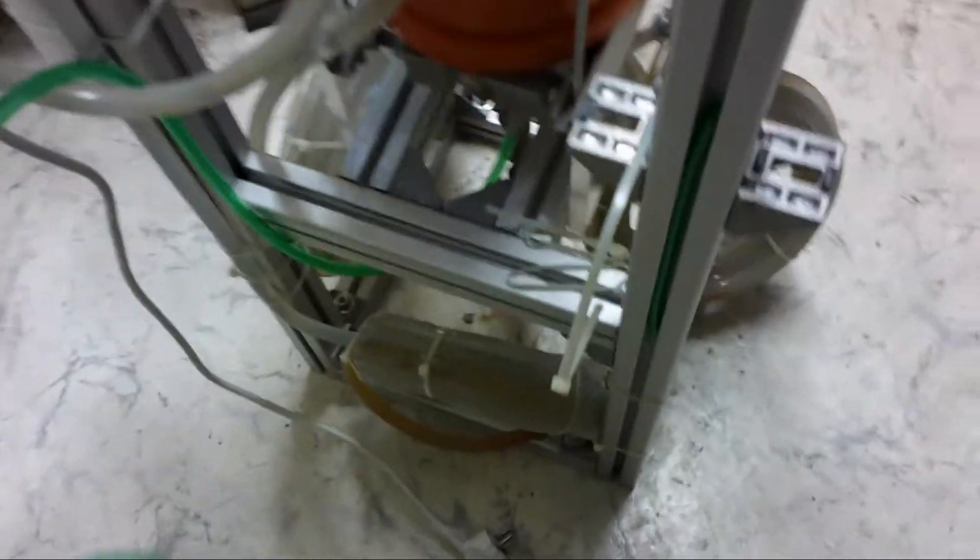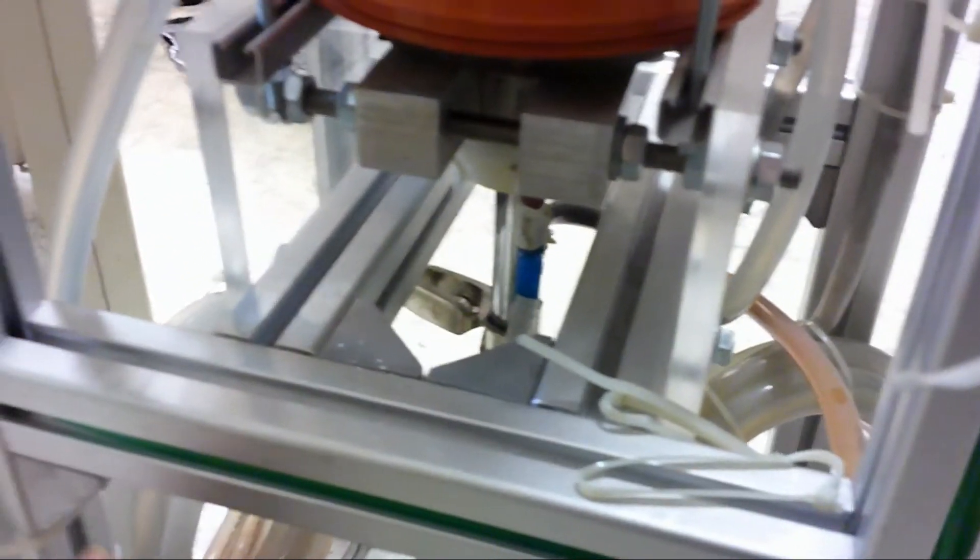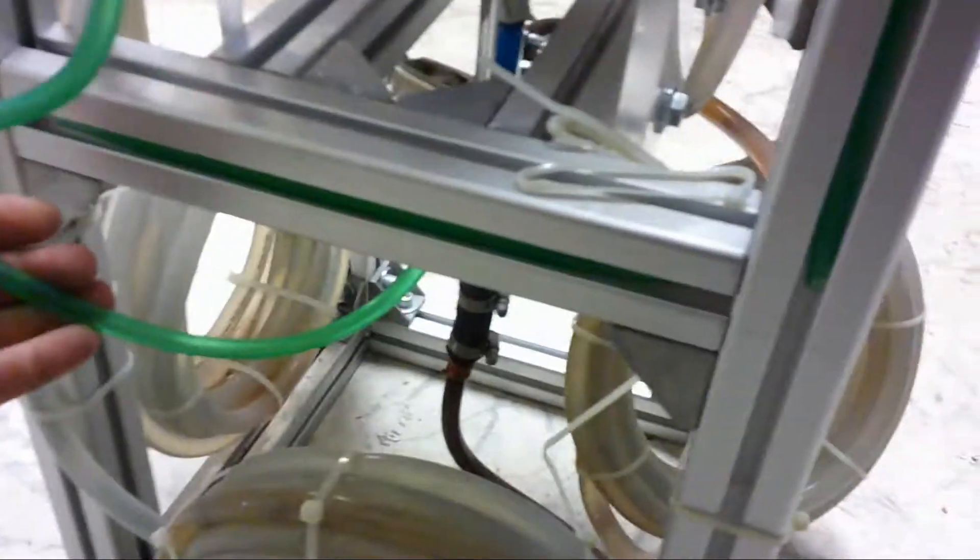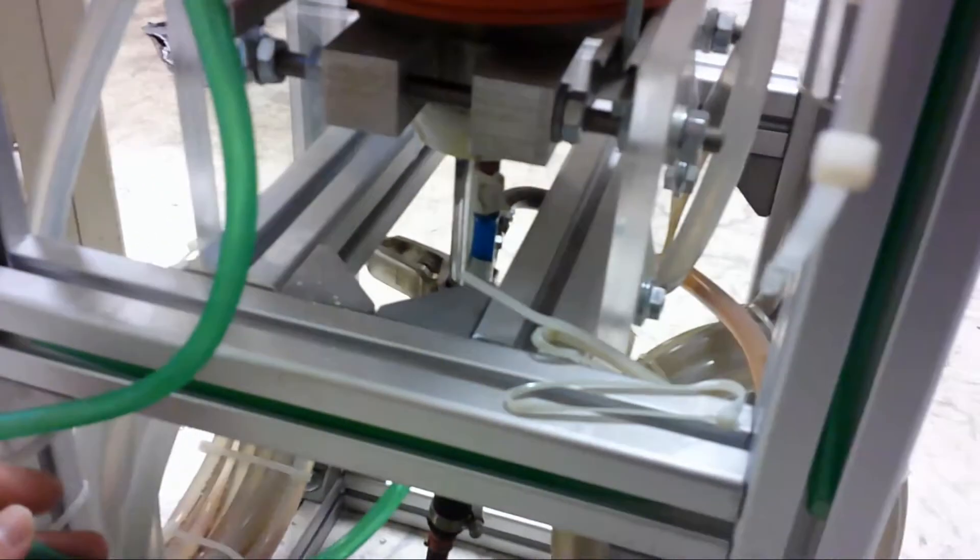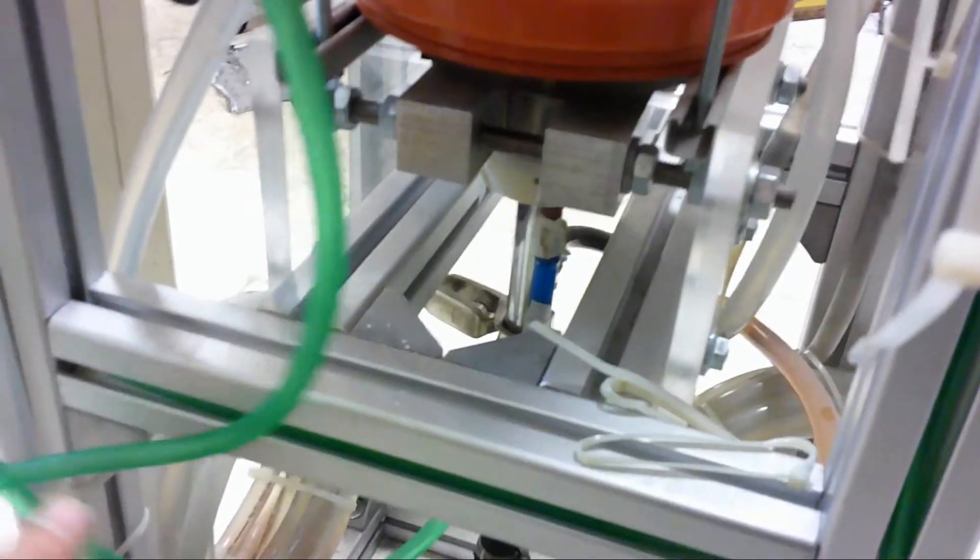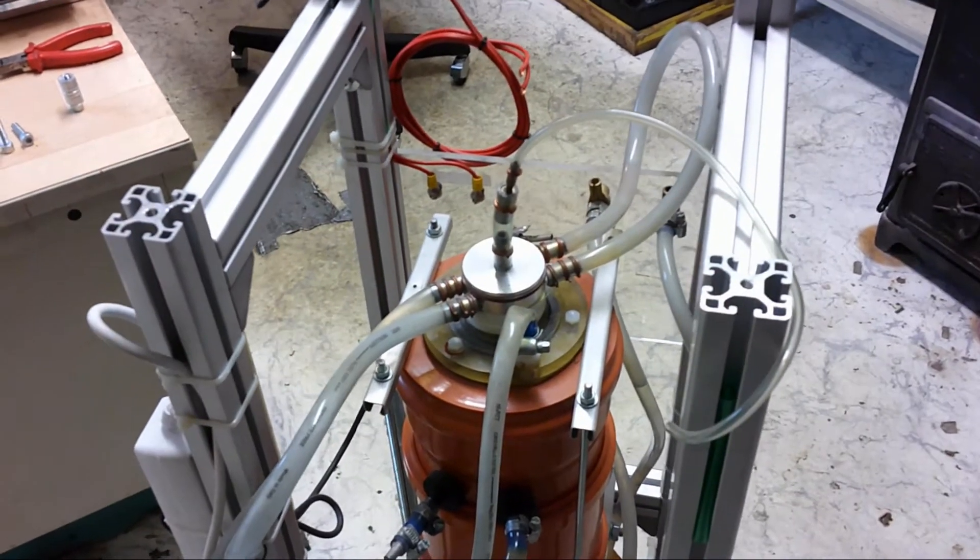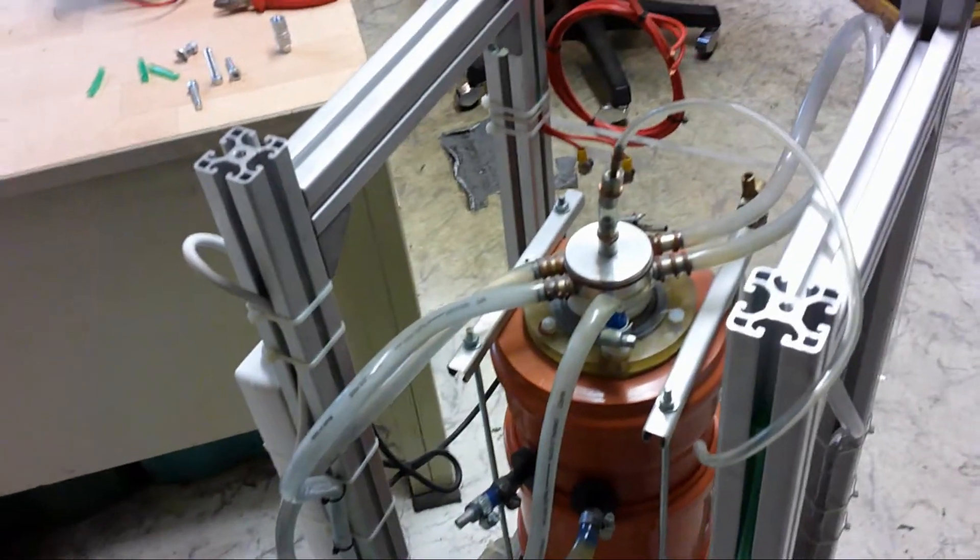And here at the other side you can see the outlet of the NO2 gas. The next step is to disassemble that completely and show you the inner parts.